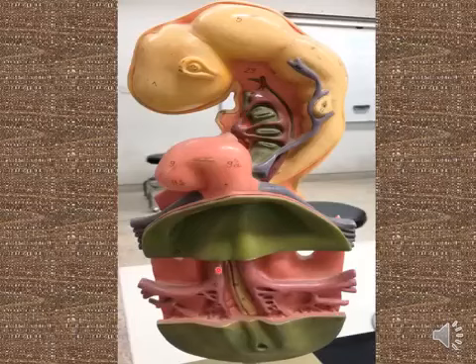Also, in this section show the dorsal aorta. The dorsal aorta derived from the bilateral angiogenetic cell clusters caudally to the formation of the heart tube. Bilateral dorsal aorta located anteriorly, separated by the head mesenchyma.